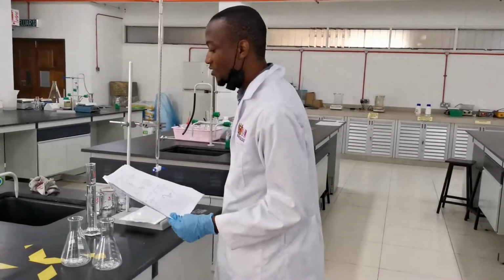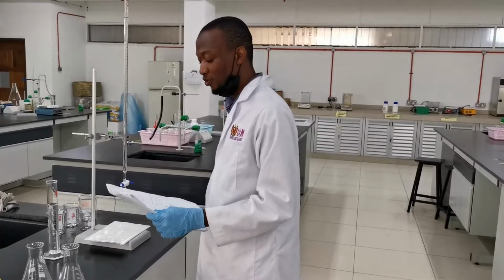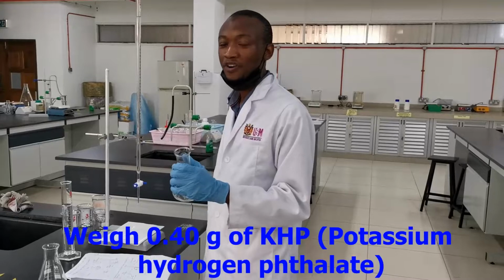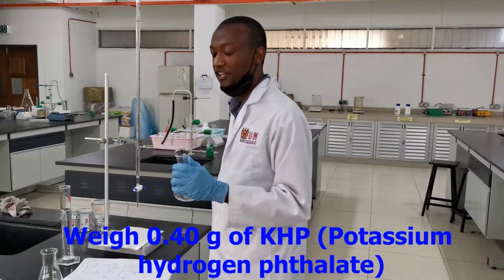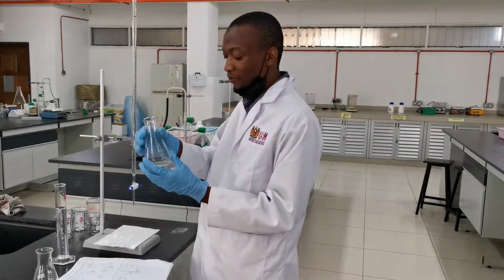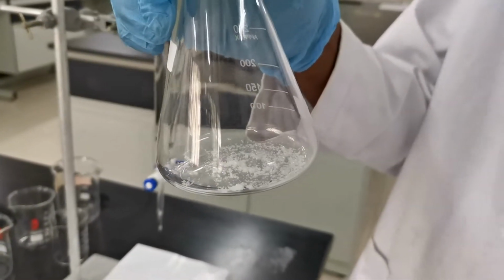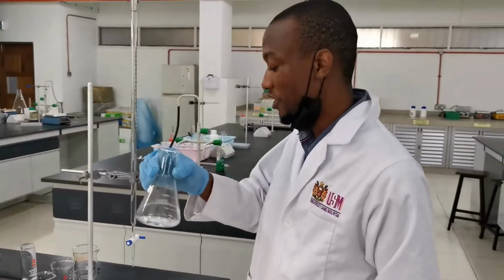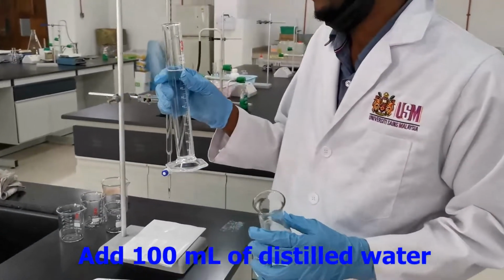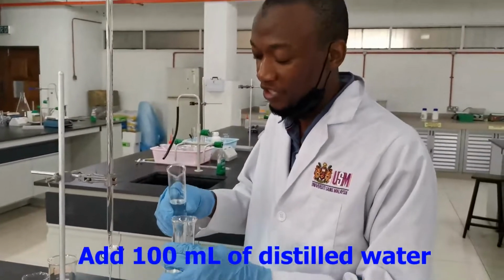With part A of the experiment, which involves standardization of sodium hydroxide solution, first weigh 0.4 gram of KHP. Our KHP is potassium hydrogen phthalate. So you can see we have the 0.4 gram of KHP in the conical flask. Add 100 ml of distilled water.